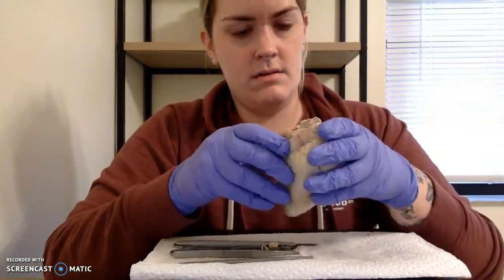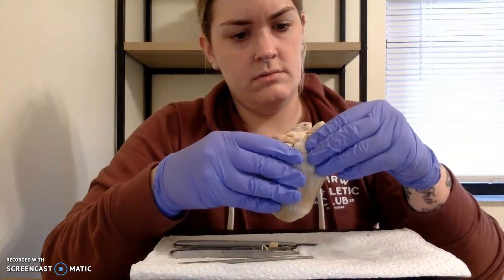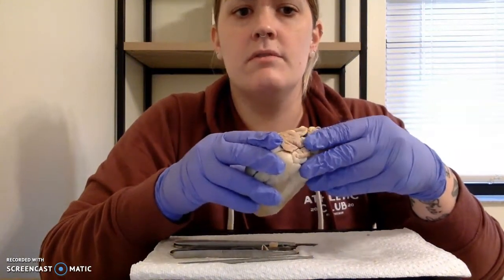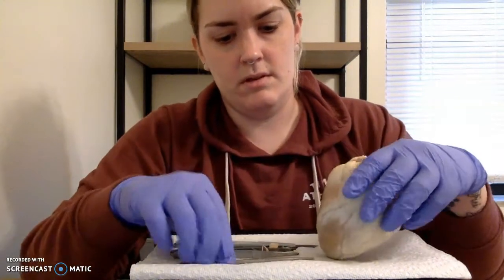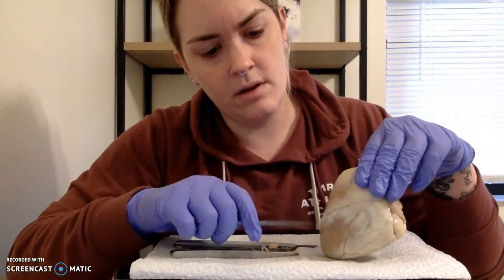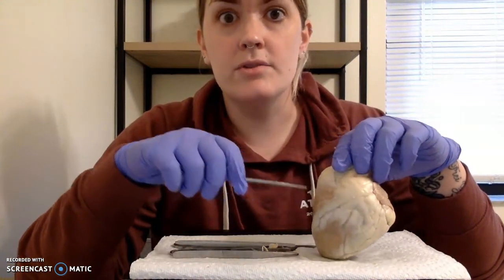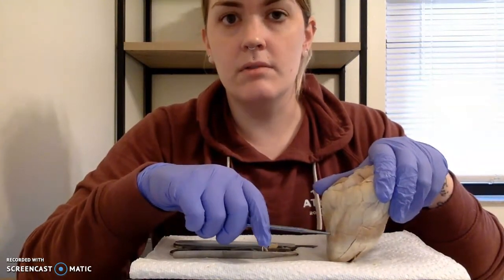And then if my specimen had coronary arteries, you would see those arteries descending from the aorta to the left and right branch. They would be on the outside, and go down here to supply blood to the heart. Each side branches into two more branches that would provide blood flow to the heart.